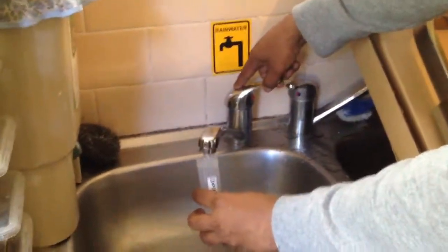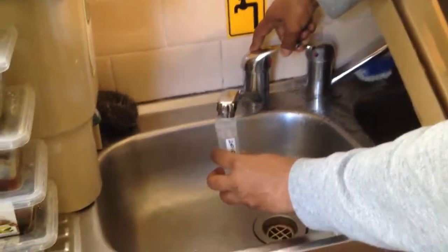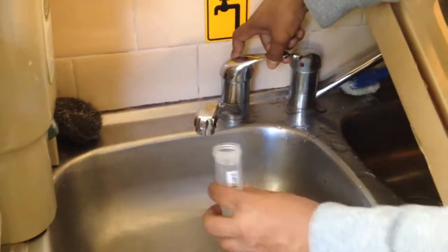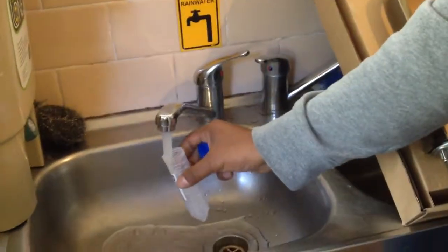You can see. And now I will just leave it in the water for 5 seconds. Count: one, two, three, four, five. Now I am taking water samples again.